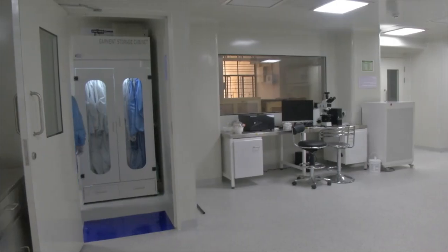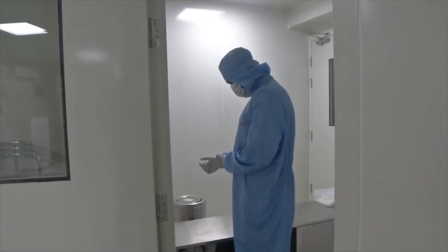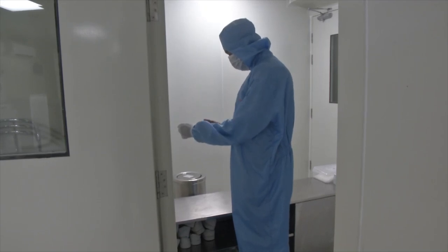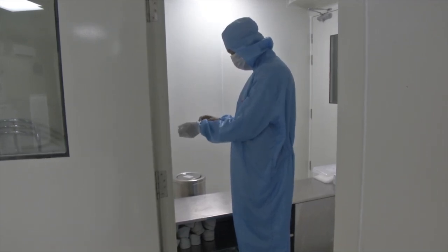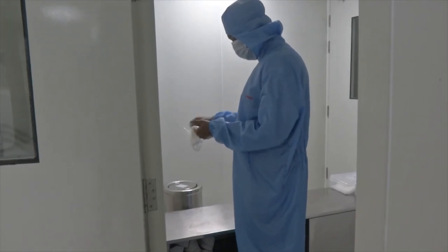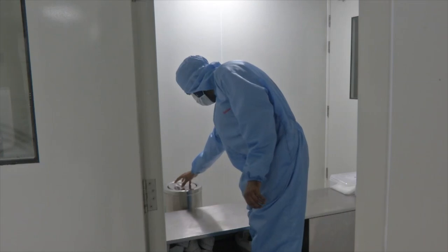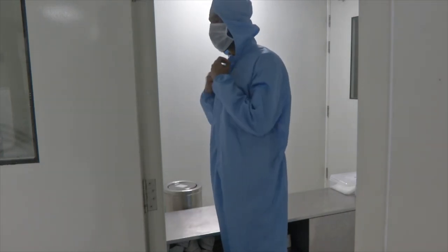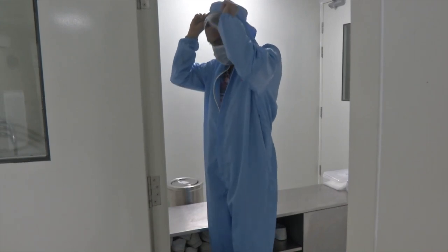My colleague will now demonstrate the process. The first step is to remove the gloves, as these are the most contaminated accessory that a clean room user wears. Since we come in contact with various chemicals, the first and foremost step should be removal of the gloves, followed by removal of the clean room gown.